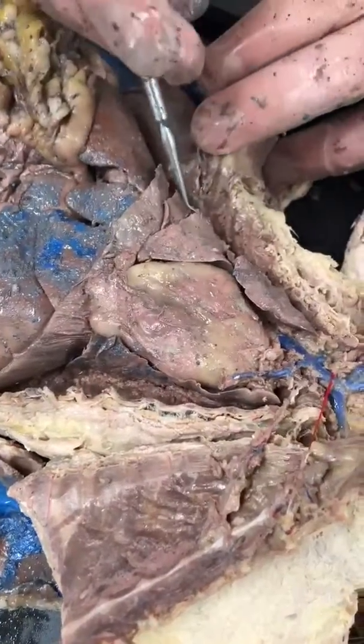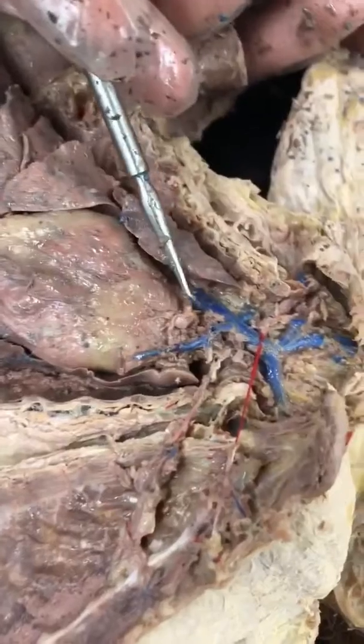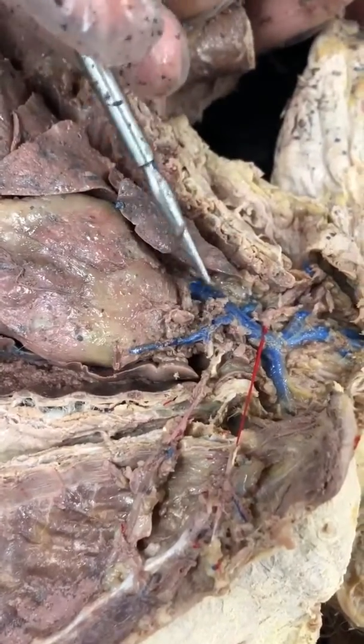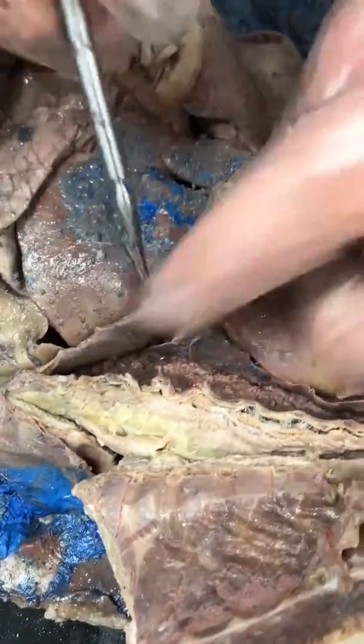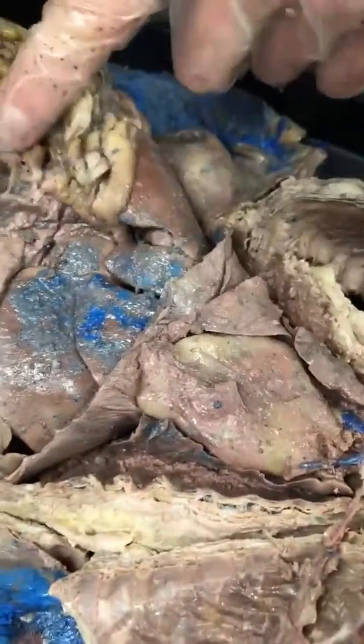They're a bit deteriorated. And we also have the thalamus, was it? In here? Oh, the thymus. Thymus in here. Wow, that thing is destroyed. Yeah, it's pretty hard to find. Diaphragm's in here. This muscle that runs all along here, separating the thoracic from the digestive cavity.